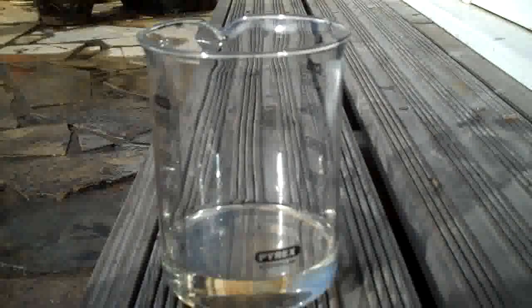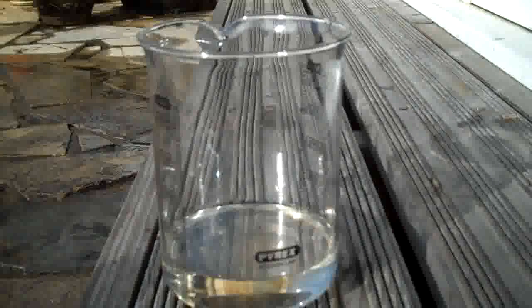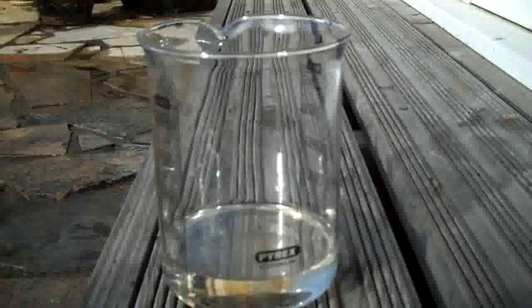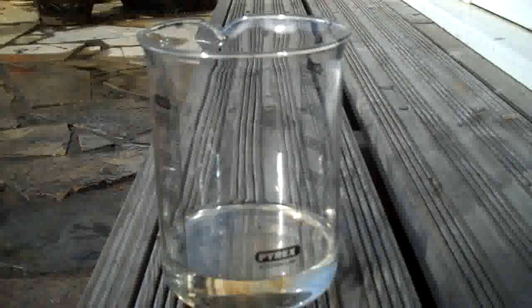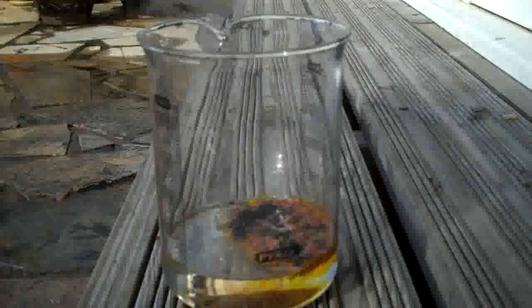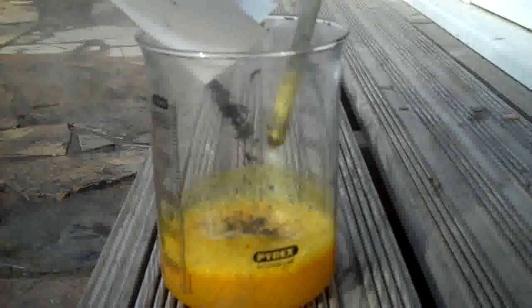There's only 100 millilitres in this rather large beaker because you get quite a lot of volume expansion. You need to account for that because when you add the graphite the reaction is already ongoing — it'll froth a bit and you need to stir it. When we add the iron chloride, we get a reaction and a degree of fizzing and heat. And there it goes — add it and stir it. You can see the large amount of fuming. This is not something you want to be breathing in, which is why we're outside.